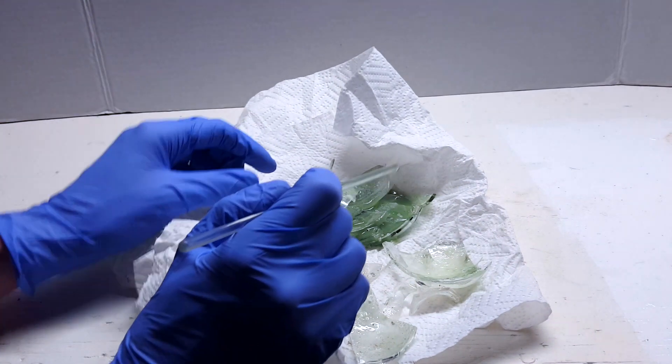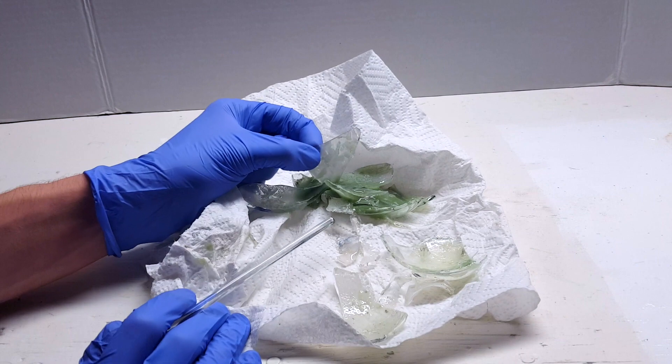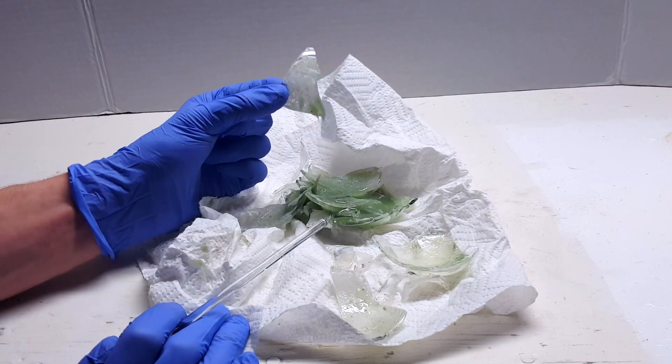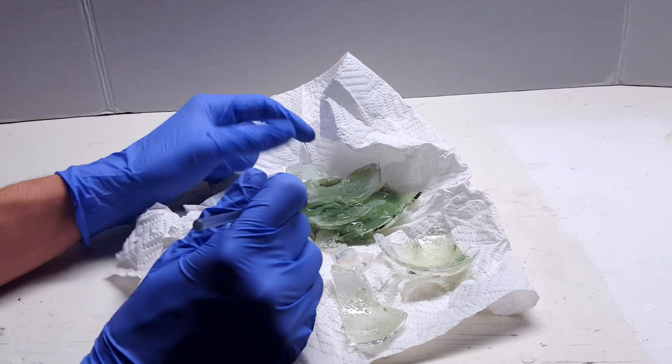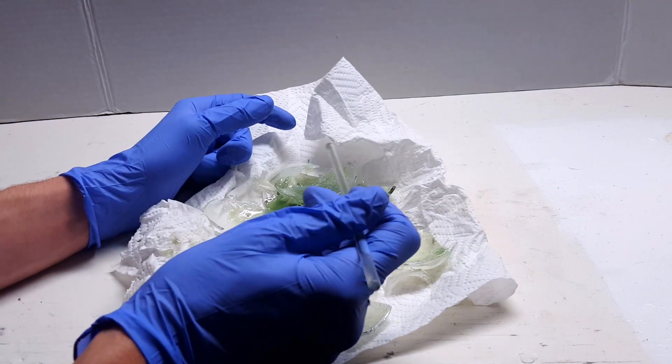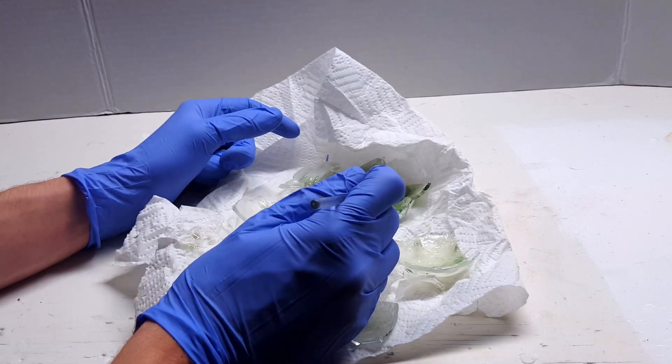Here's what was left inside the distilling flask, a goopy material that dissolved and evolved gas in sodium hydroxide solution. This substance must have been a mix of pyro and polyphosphoric acids formed at those high temperatures.